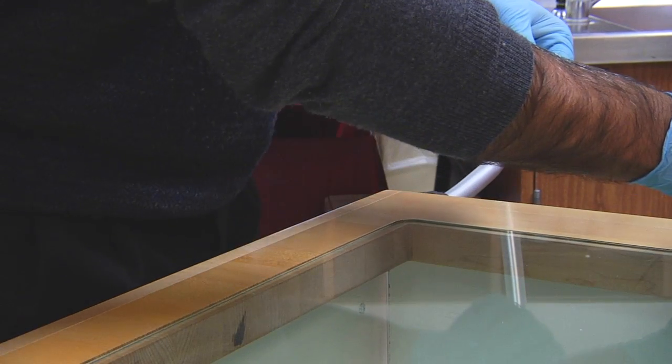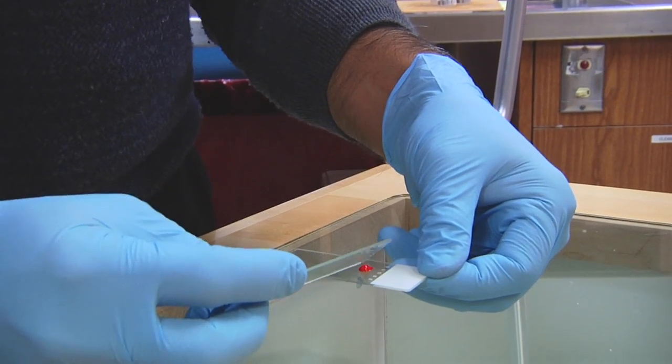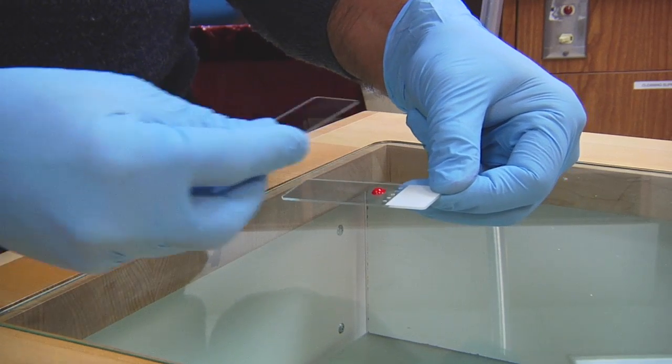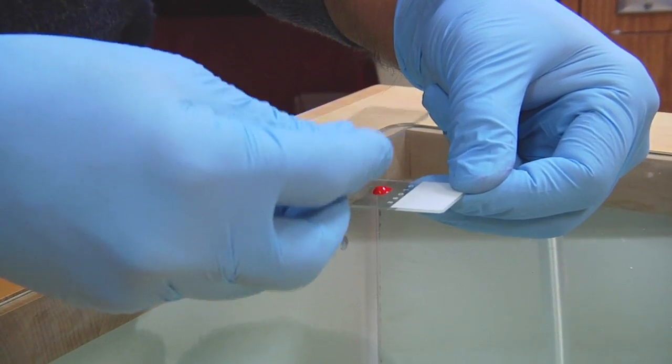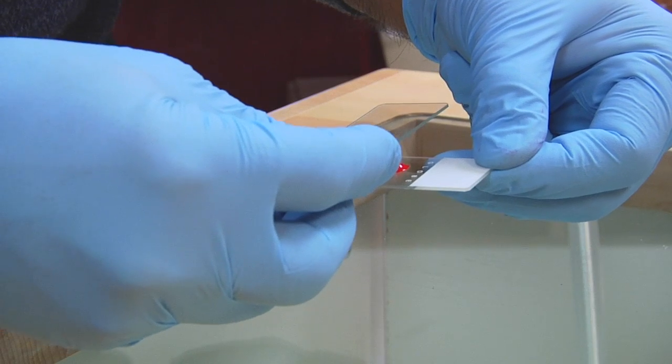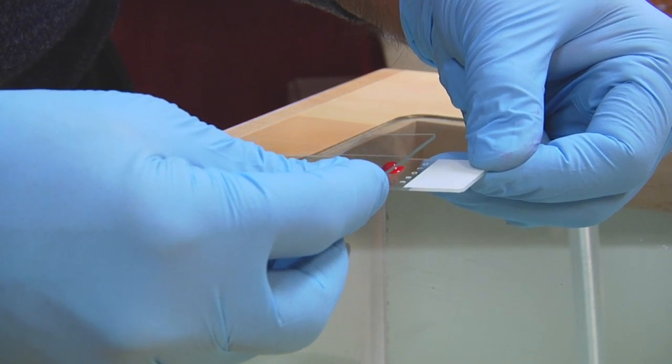It is critical to ensure that the material to be spread is placed as close to the top of the slide as possible because in this particular technique the right hand which is holding the smearing slide moves across the left hand to make a smear as follows.